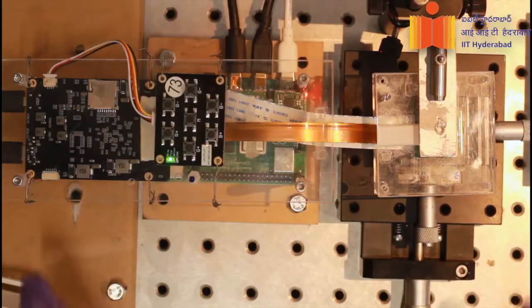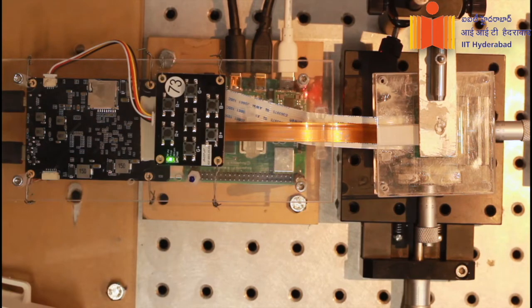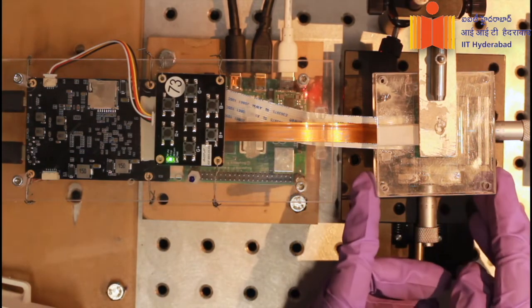Hi, I am Saurabh Kumar, a tech student. And I am Ekta Prajapati, a research scholar. In our lab we have developed an on-chip lensless microscope called MuScope, which we will be showing in this video. This is the top view of our homemade imaging setup, called MuScope.